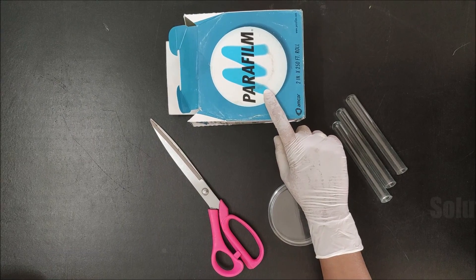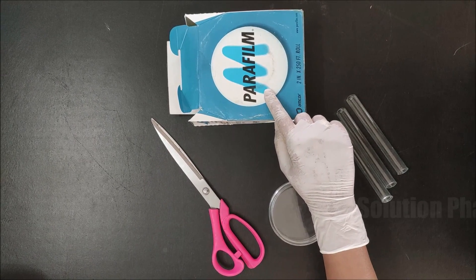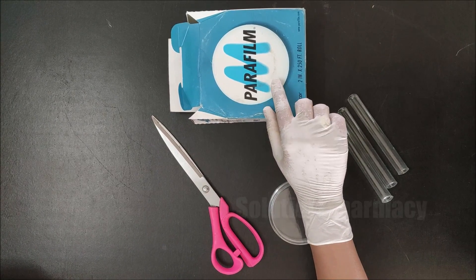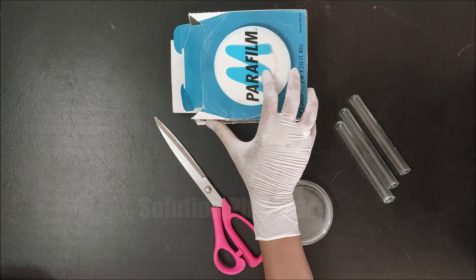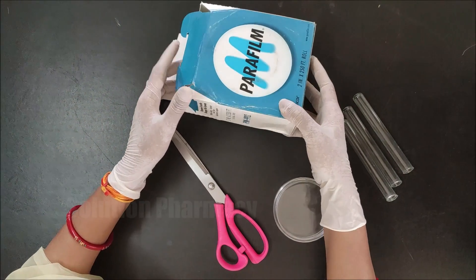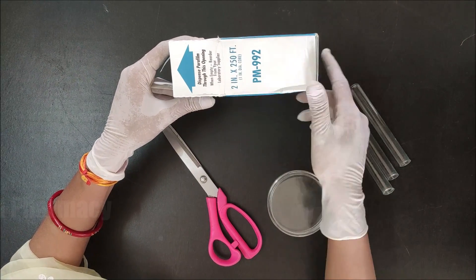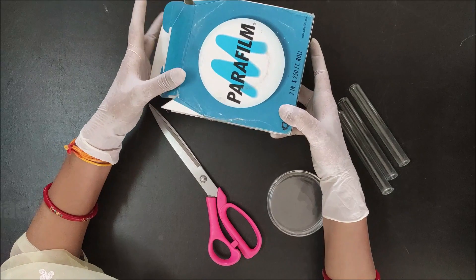Welcome to the channel Solution. Today in this video we will tell you about what is parafilm and how it is used. Here you can see this is a box of parafilm, and inside there is a complete roll of parafilm. From this opening we will dispense parafilm as indicated on the box.